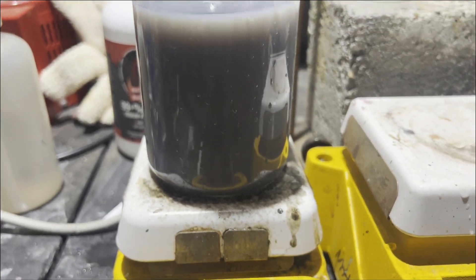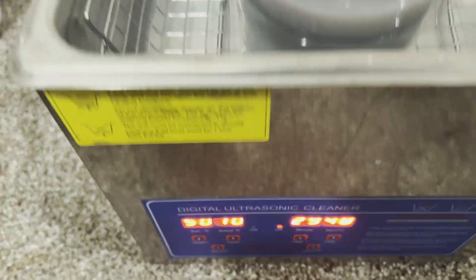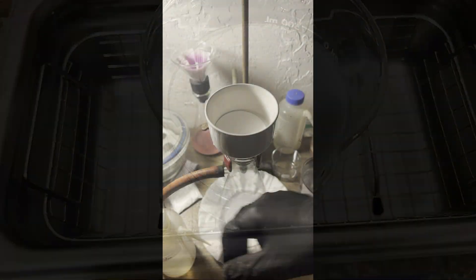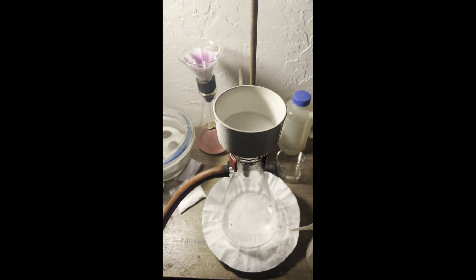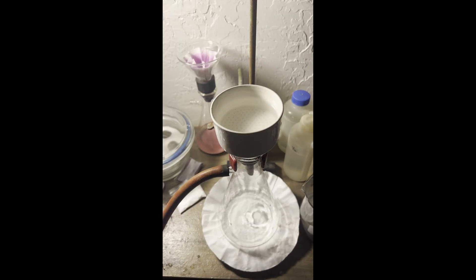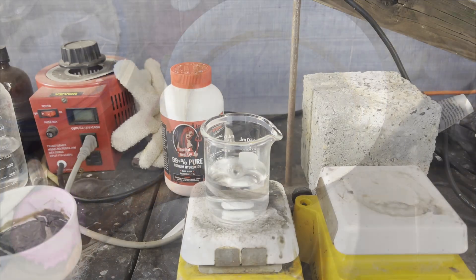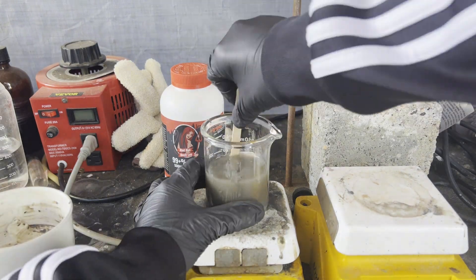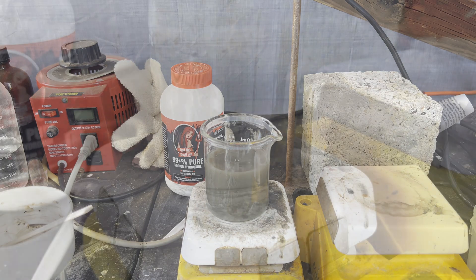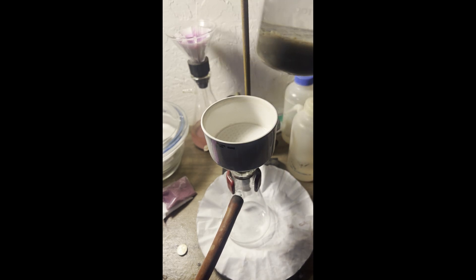On the edges of the funnel, the color became more brown, which was supposed to be the color of the precipitate according to the paper I used, so that's good. I transferred the filter cake to a beaker with 400 milliliters of distilled water to wash contaminants from the original solution. It wasn't breaking up quickly, so I sonicated it, which helped. Then I let it settle and filtered again — this time about two and a half hours, leaving a less gelatinous product. After leaving it on the pump overnight, cracks formed and the color became grayer and browner. I then boiled it with acetone to remove residual water and break down the gel structure, which made filtration much easier — only six or seven minutes.